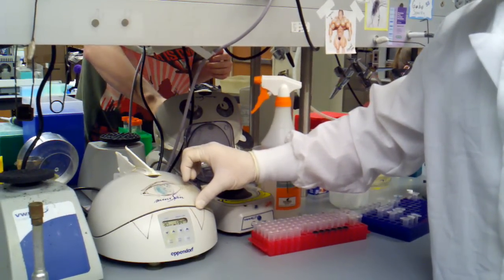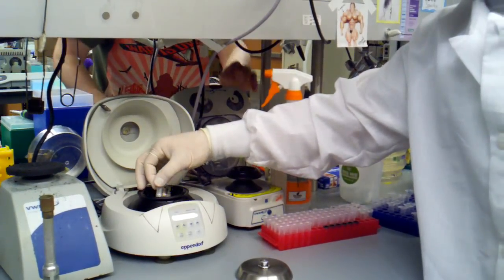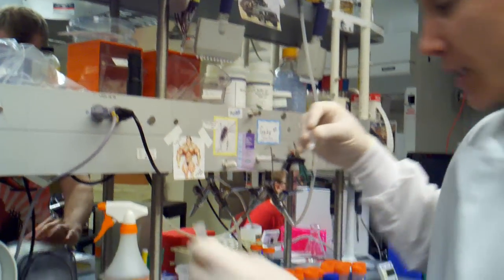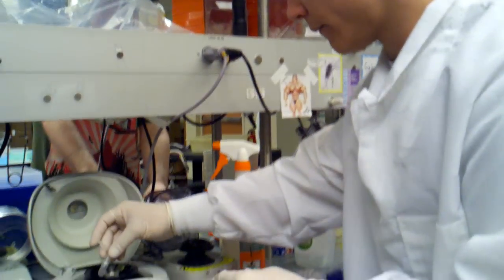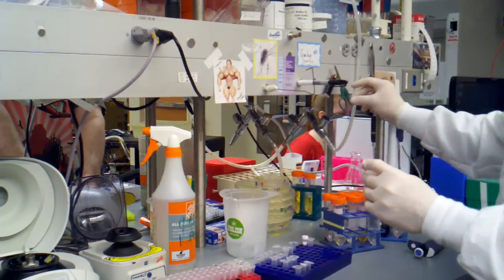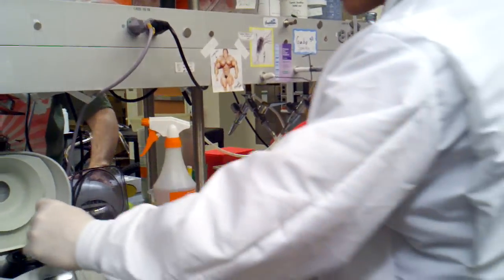We have spin number one. At this point, we want to check and make sure that everything went through; sometimes it can get a little bit clogged up. It looks like everything went through, and you're going to discard the flow-through. Now we're going to be adding in 500 microliters. I'm actually going to cut the top off since I only have one sample.